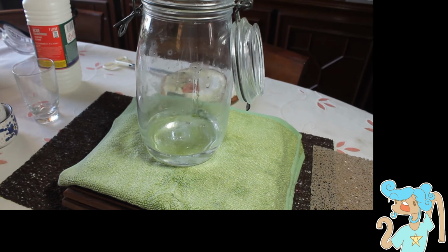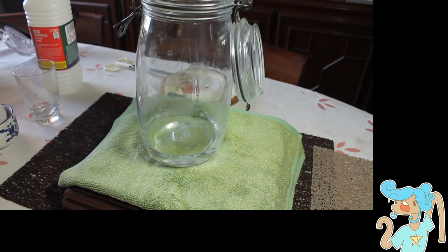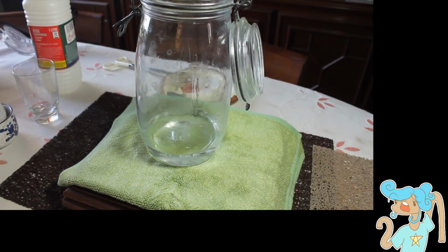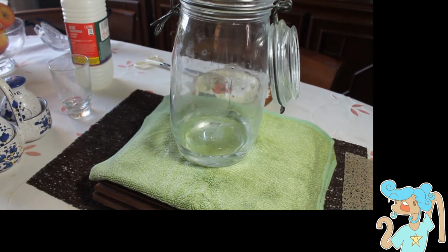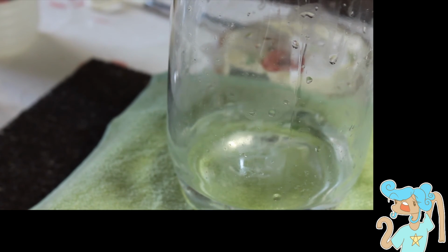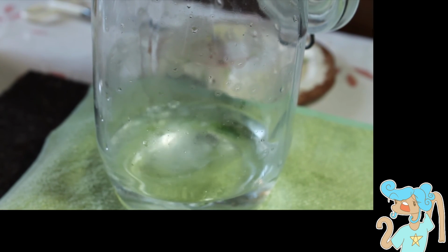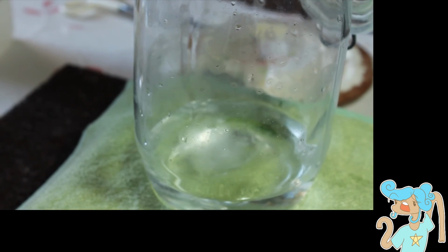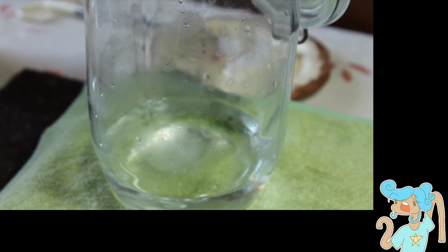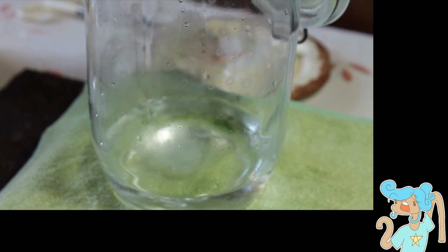We have some kind of reaction. It's turning white, where it was colorless. It's stringy. I don't know if you can see. You see stringy soap inside. It was yellowish anyway, it wasn't that color. So there's a bit of a reaction.